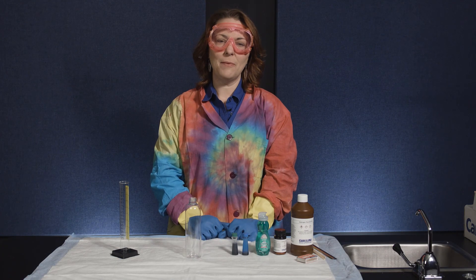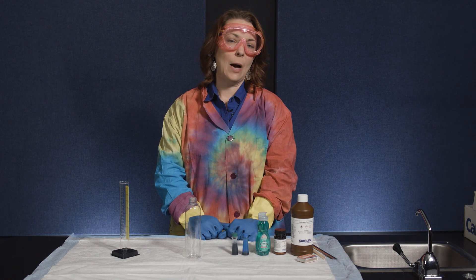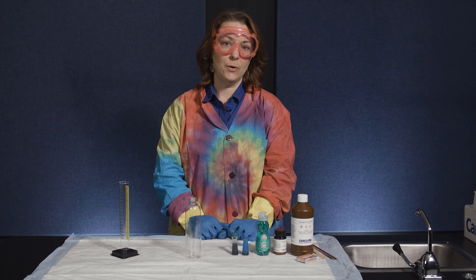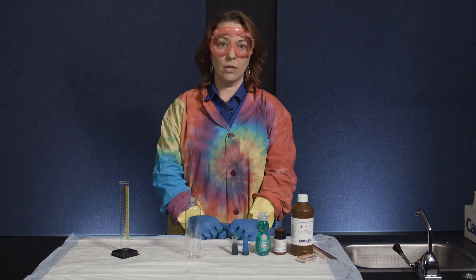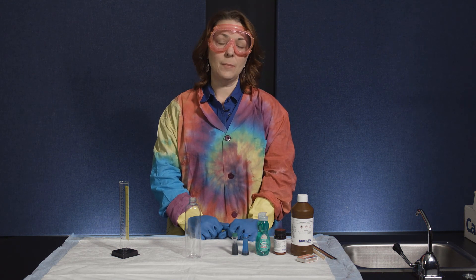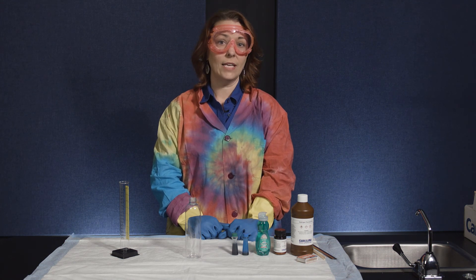Today we're going to do the elephant toothpaste demo. This is another classic chemistry demonstration of a rapid decomposition of hydrogen peroxide. The hydrogen peroxide you typically get at the drugstore is 3%. Today we're going to be using 30% hydrogen peroxide and we're going to speed up its decomposition with the use of a catalyst.